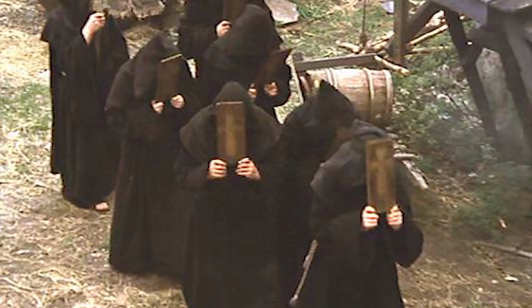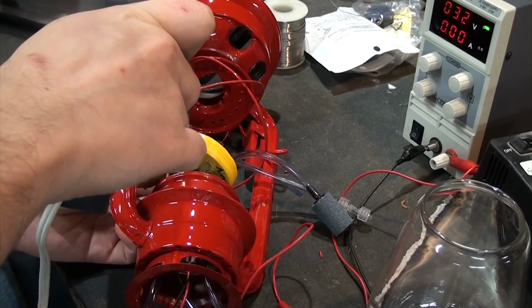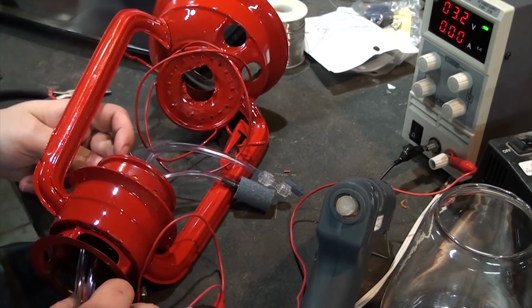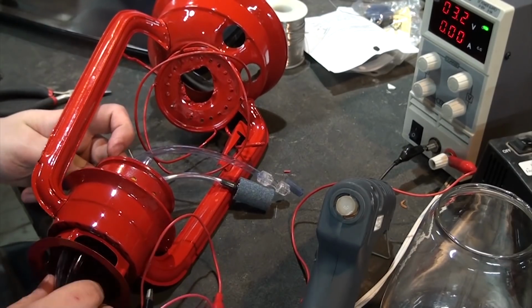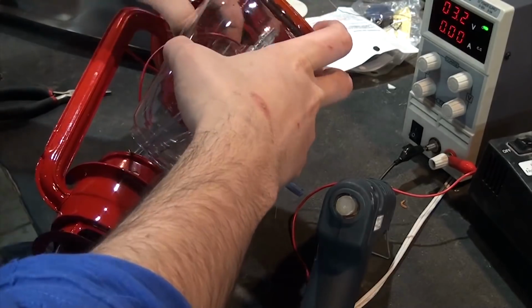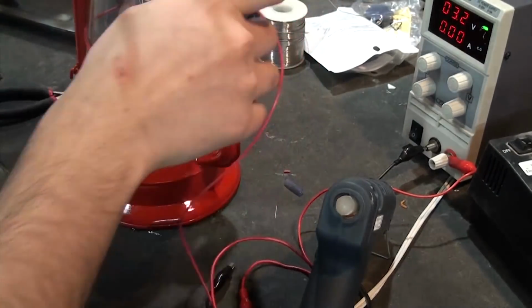Finally, having the patience of a monk that somebody slipped a handful of caffeine pills, I started assembling everything while the paint was still a little bit wet, because I am not a smart man. First, the plug could be mounted to the lantern using some hot glue. To make sure this was as close of a fit to the glass as possible, I quickly added the tank and closed everything up so that it would dry in place. The hot glue also formed a nice gasket that the glass can fit into when this closes up.